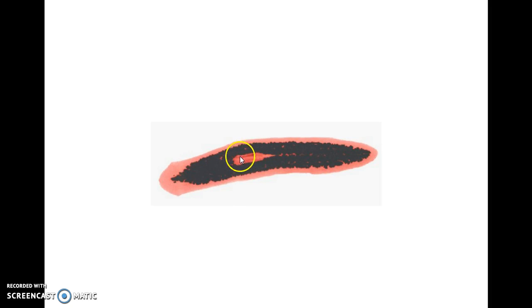It's basically just a cavity, an opening inside of the worm, and on the underside of the worm is a little tube where it would suck water in, extract the nutrients, and then expel the wastewater right out of the same opening. It lives in the water in ponds.